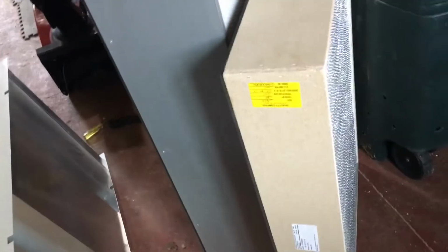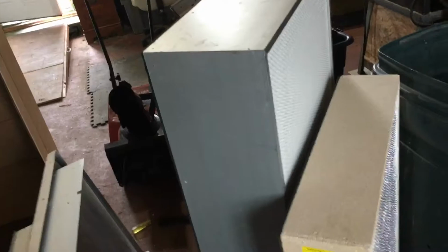Eric, I saw your video. After I ordered my 2x3 filter, which is here, unfortunately the 2x3 filter is much too short for this, so I was thinking I would slice this box open and maybe fit it in and block the unused portion off with wood. There's no real easy way to get this filter out, by the way.